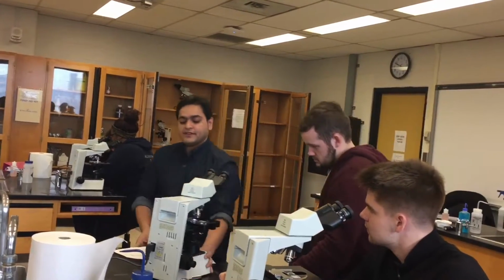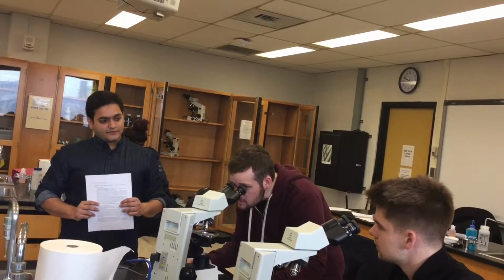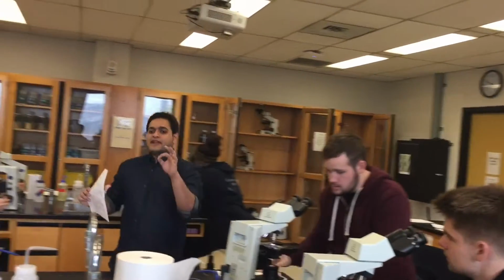Have a look at what I'm looking at. You want to make it big. Not that one. Are you able to see it? Spots. Yes. So those are the bacteria.